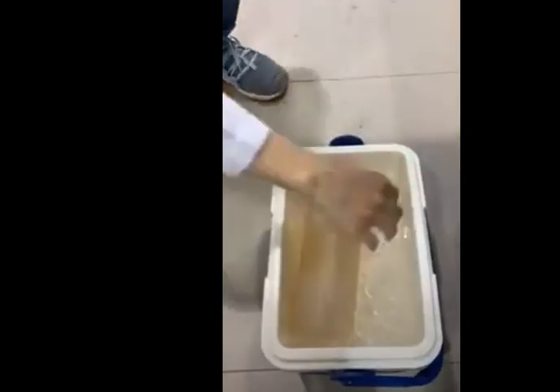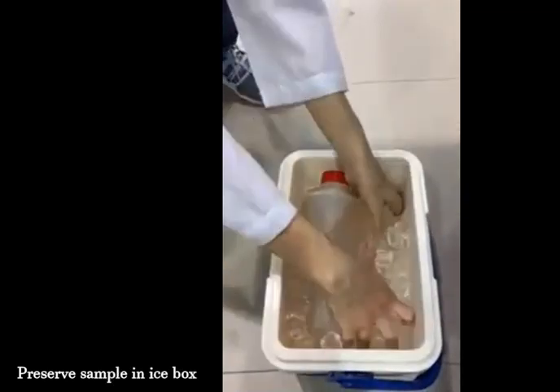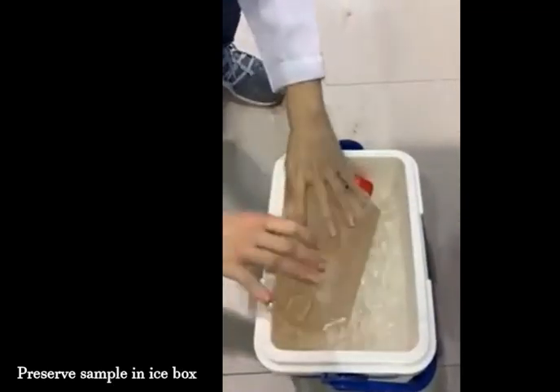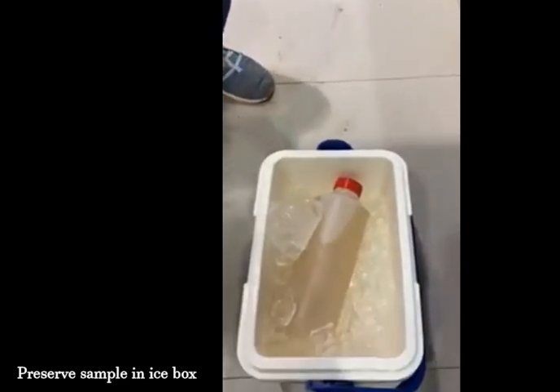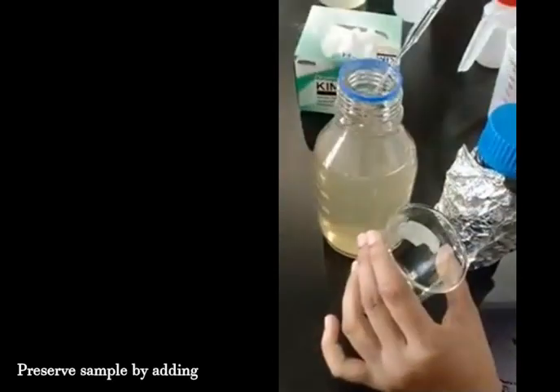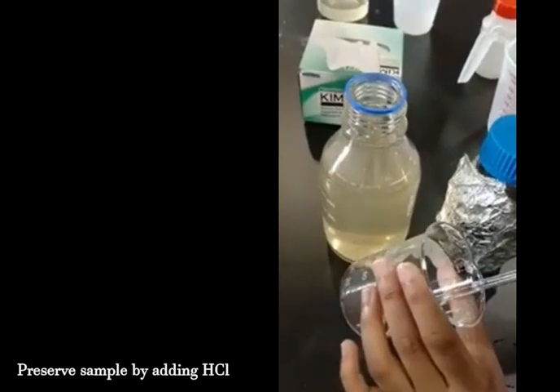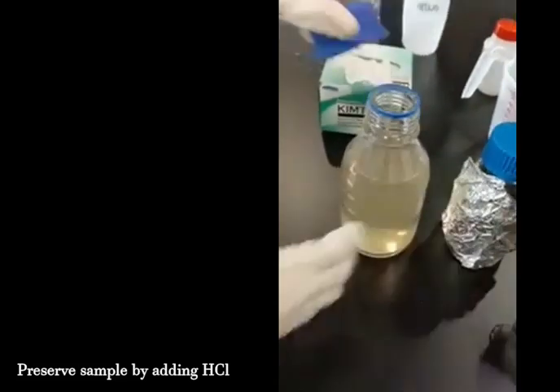There were 2 preserving methods adopted. The first is putting the plastic bottle containing the water sample in an ice box, keeping it at low temperature to prevent changes in the growth of microorganisms before it is placed in the fridge. The second is adding hydrochloric acid into a glass bottle containing the water sample, until its pH is below 2, to preserve the hardness.